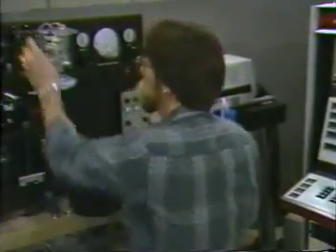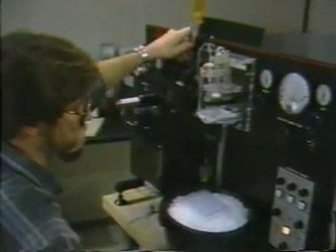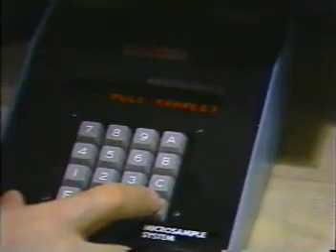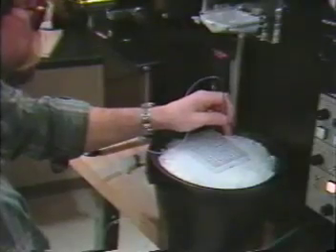During this portion of the presentation, however, we'll simply introduce you to what FACS Desk does and how it works. This way you will be familiar with each aspect of the FACS Desk system so that learning to operate it will be fairly easy. Keith is now delivering a sample to the FACS for analysis.